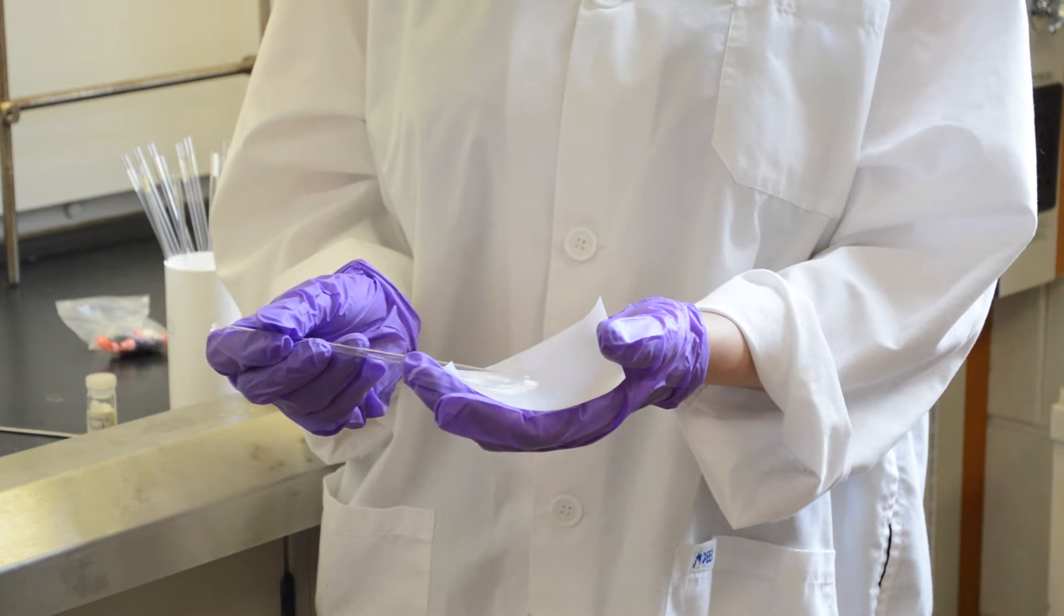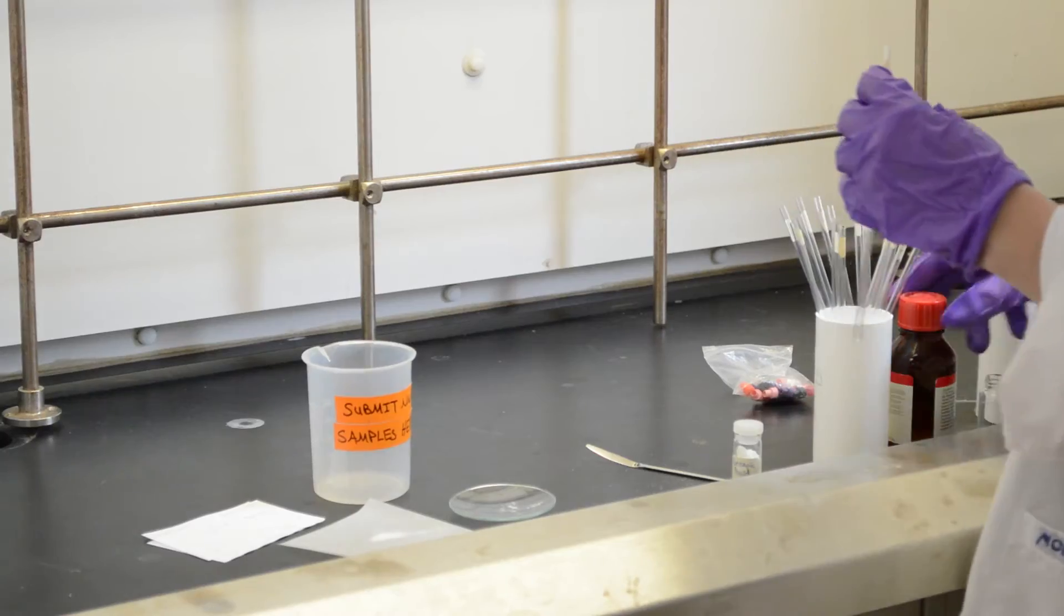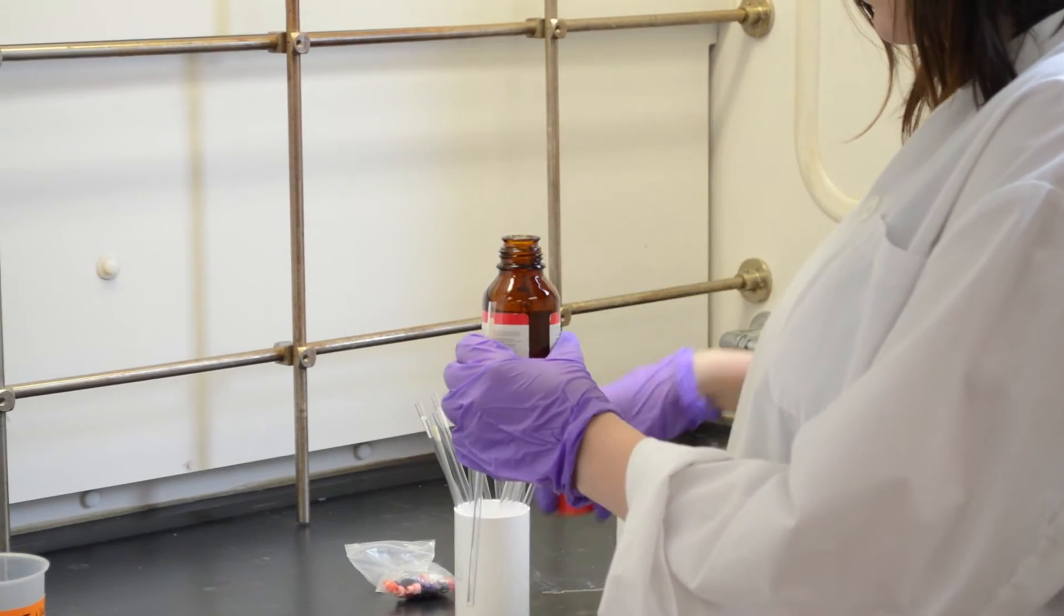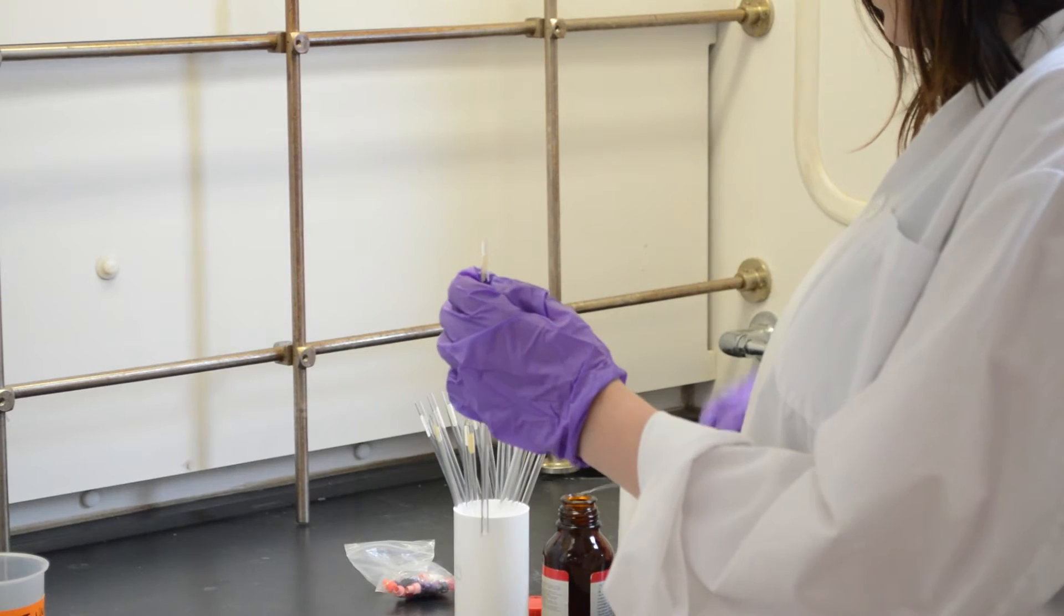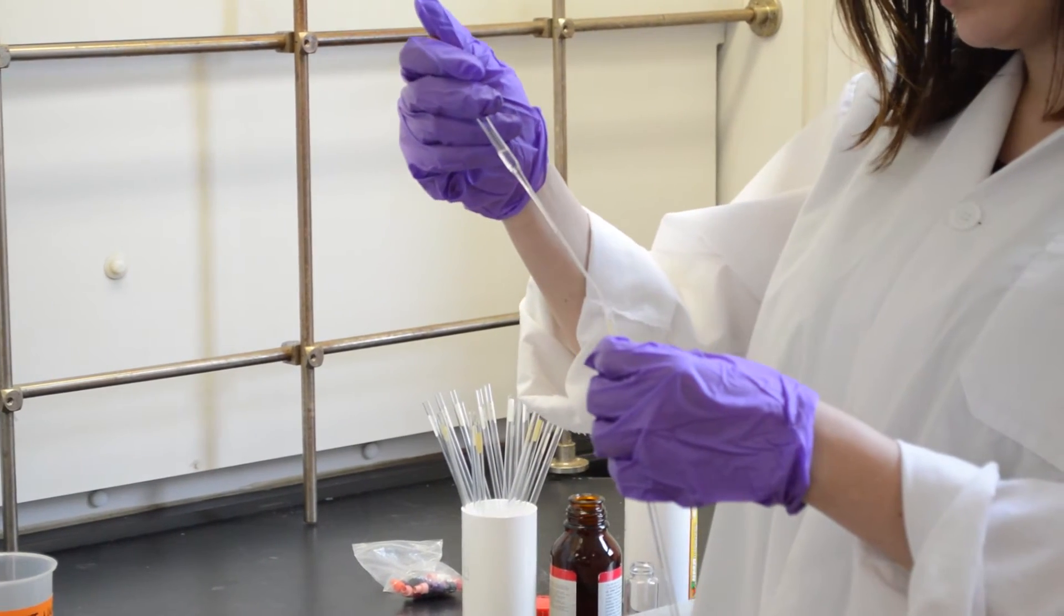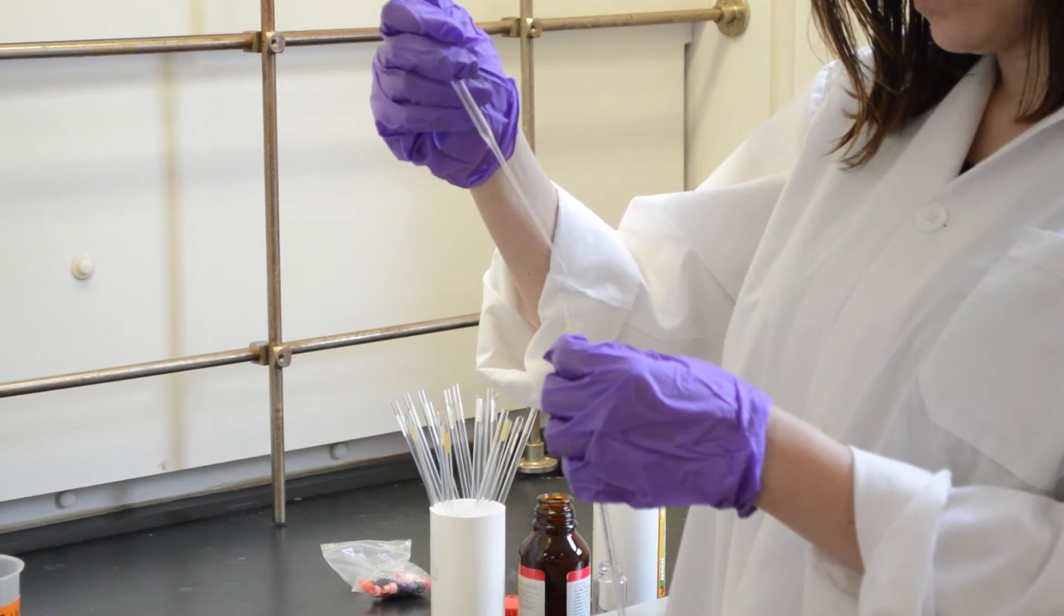Then lightly tap to allow the solid to go in. Then take deuterated solvent and add it.